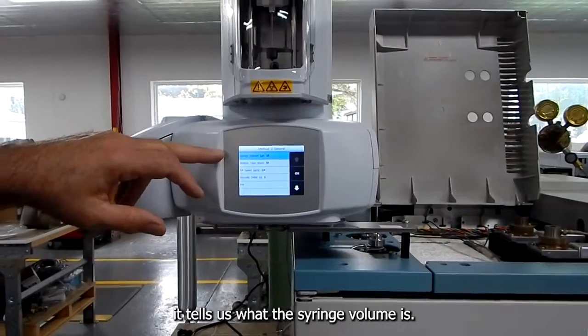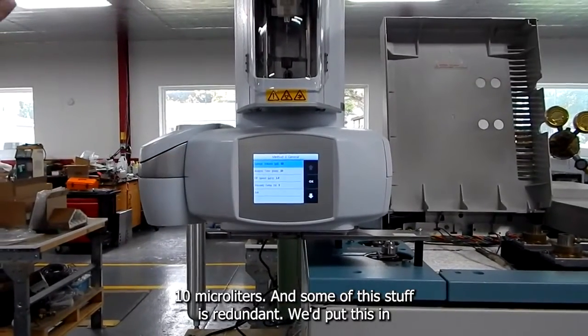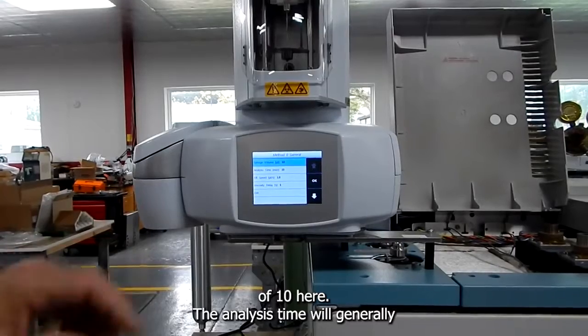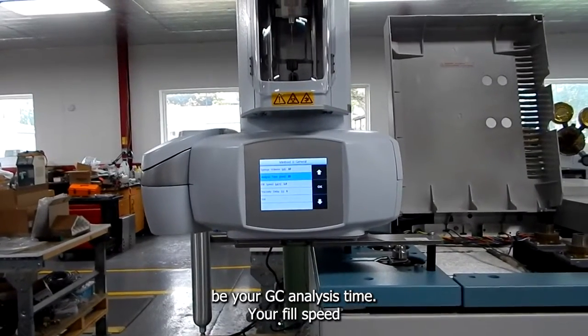it tells us what the syringe volume is, 10 microliters. And some of this stuff is redundant. We put this in when we change the syringe. You should know that. And that's probably why it's in a default of 10 here. The analysis time will generally be your GC analysis time.